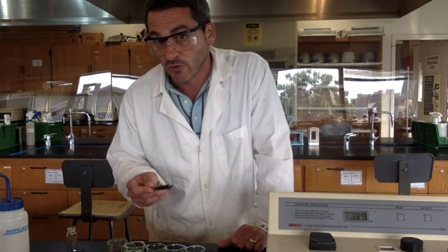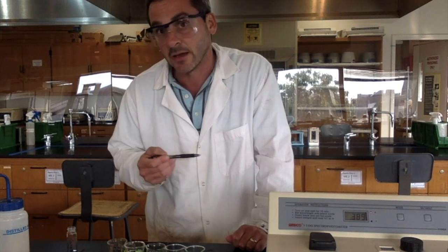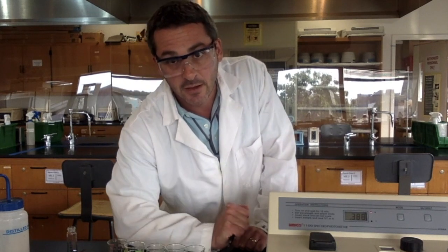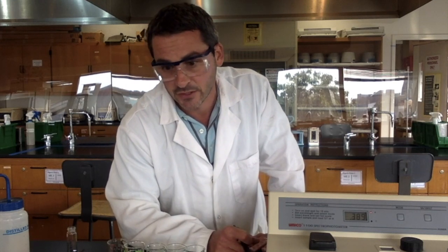So its concentration will be in between the concentration of C and the concentration of B. That's how this works. The absorbance and the concentration of these solutions are directly related. It's called Beer's law. All right. If one solution has twice the absorbance of another solution, that means it has twice the concentration. If it would have half the absorbance, it would have half the concentration.